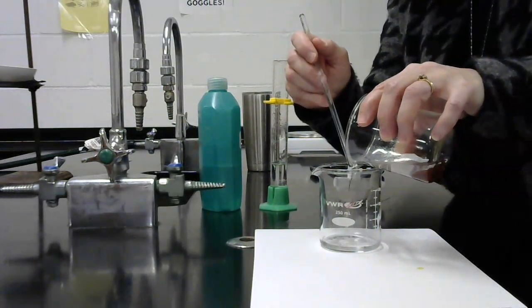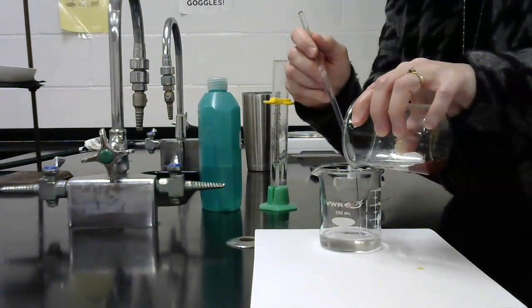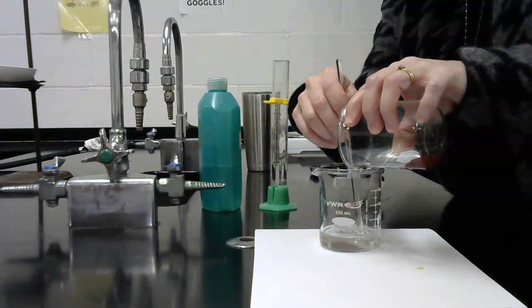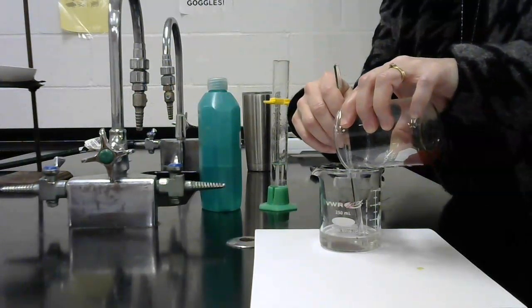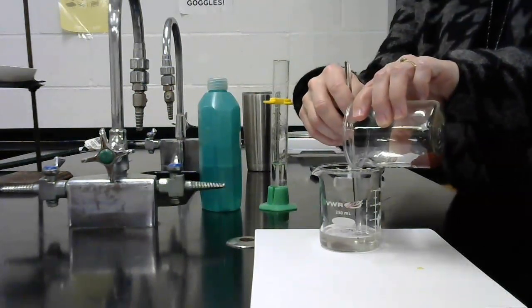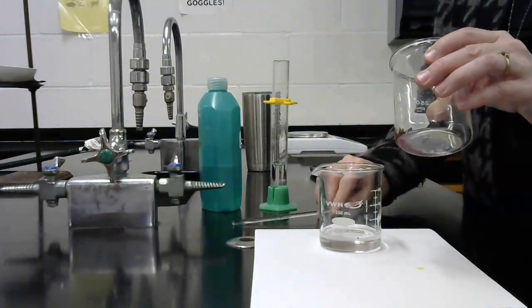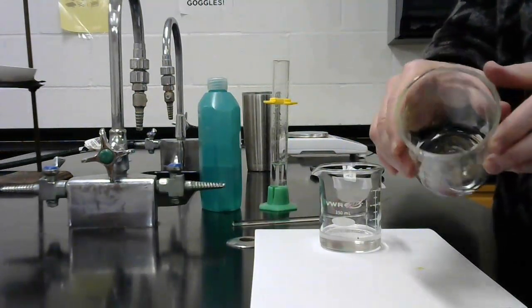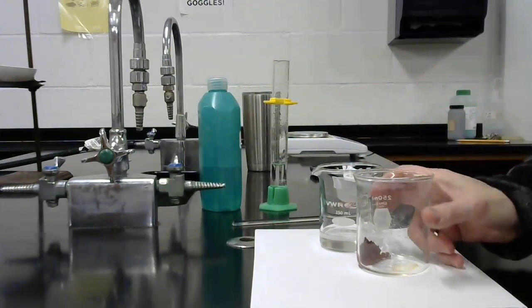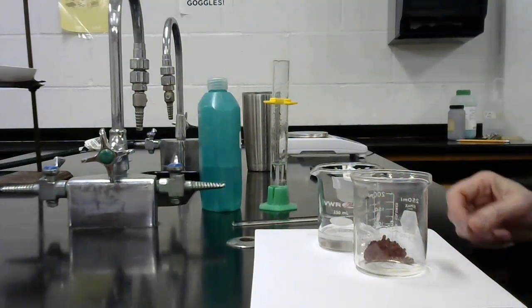So you can see I'm pouring off the clear liquid, and that copper is still going to have some liquid on it, but it's just decanting here. There we go. Looks like all of my precipitate is staying back in the beaker. And I will put this in the oven. So you can see, it's kind of hard to see, there it is against the white background, there you can see it. That is my copper that I collected out of there.